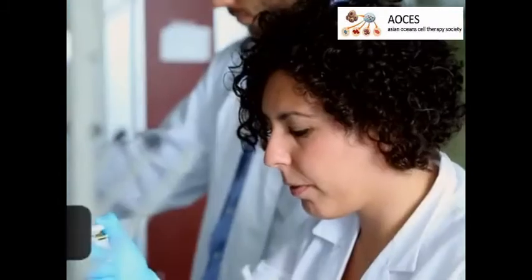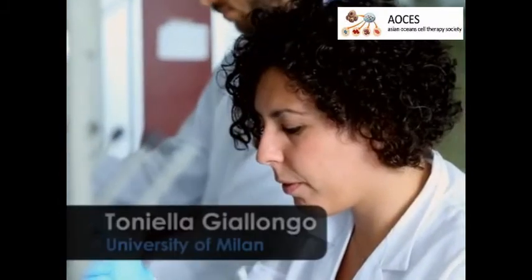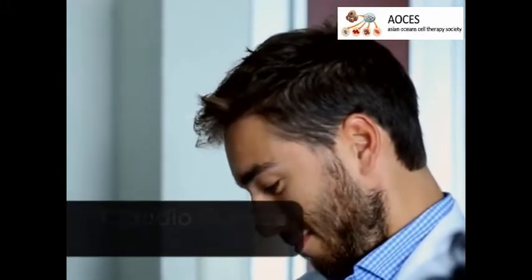Demonstrating the lesion will be Dr. Toniella Giallongo, a PhD student in the laboratory, while the tail injection will be performed by Dr. Gerace, a postdoctoral fellow in the lab.